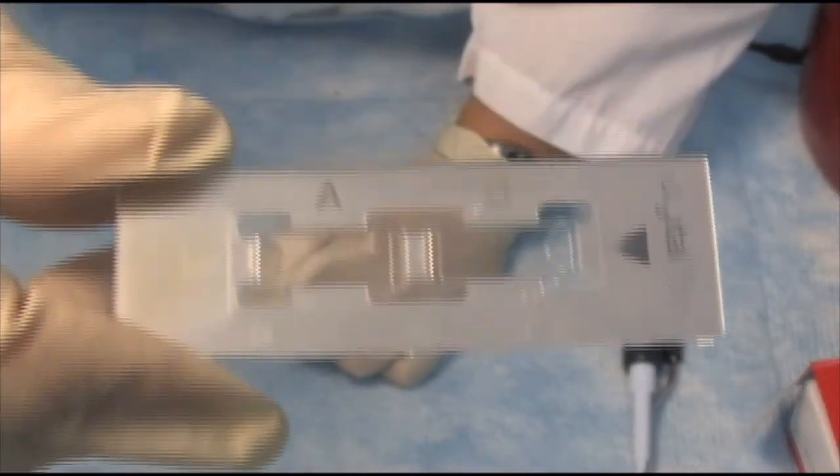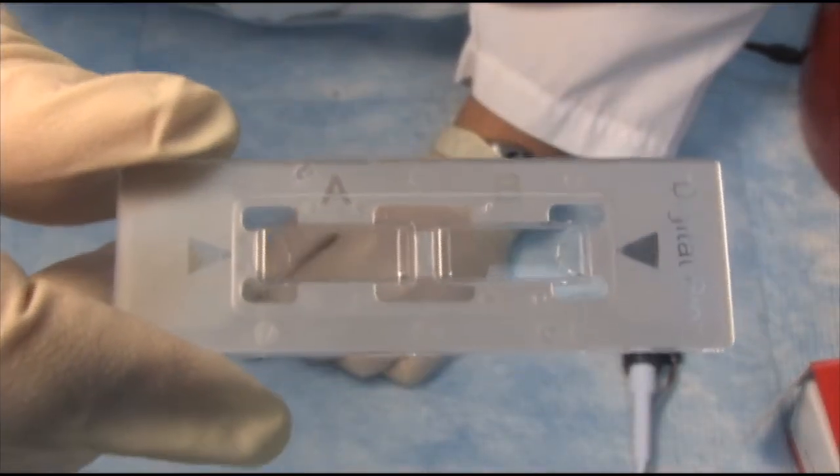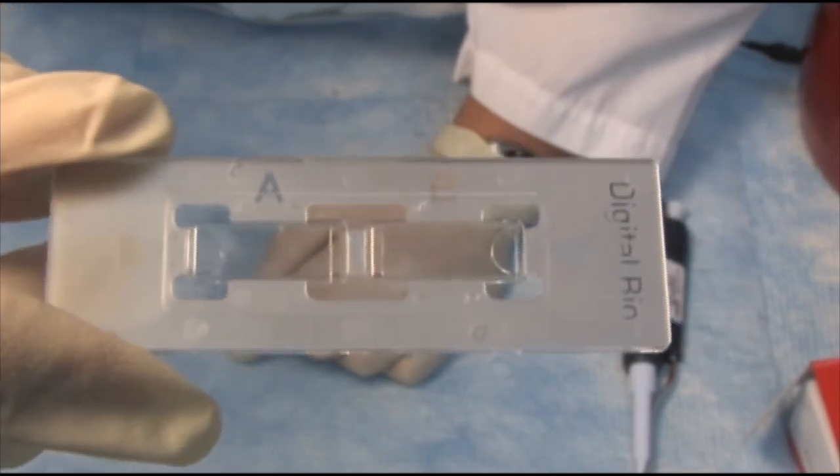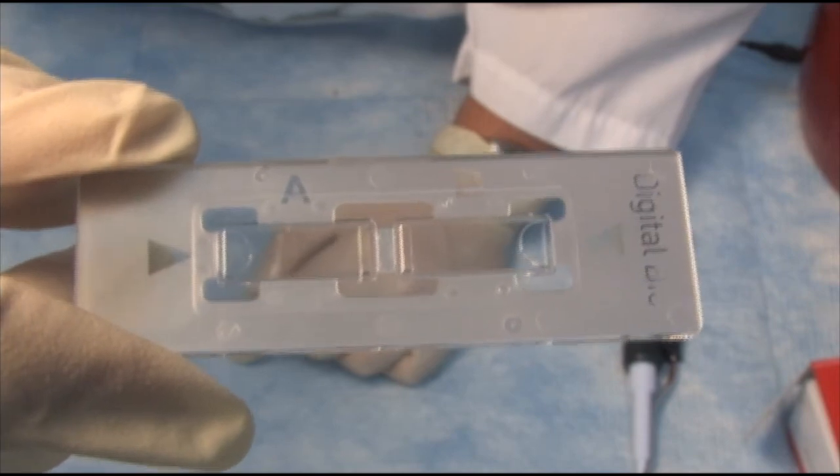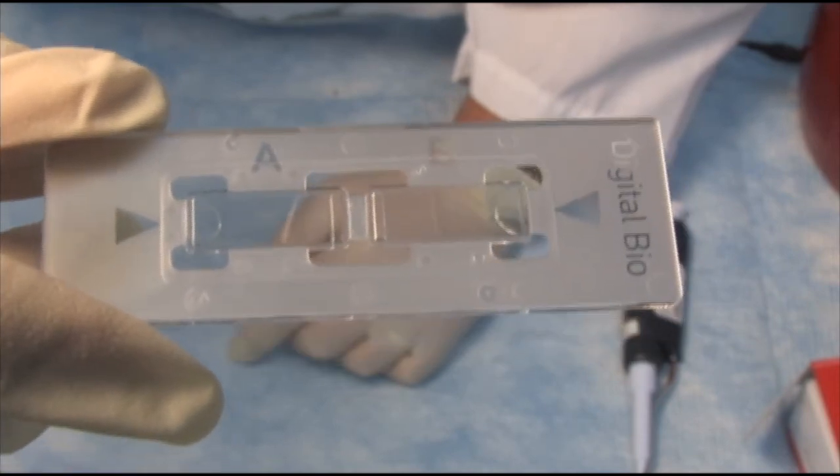Here's what the slide looks like. It's got Chamber A and Chamber B. And make sure you can read digital bio, making sure you're on the right side of the slide when loading.